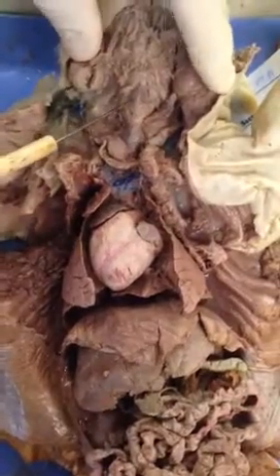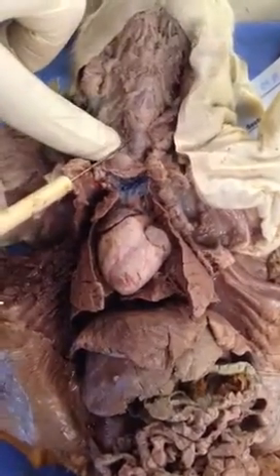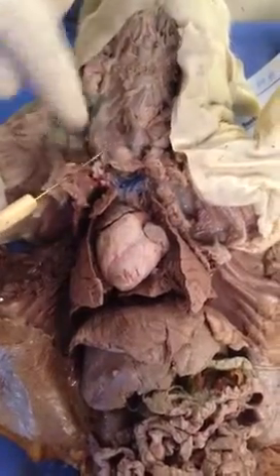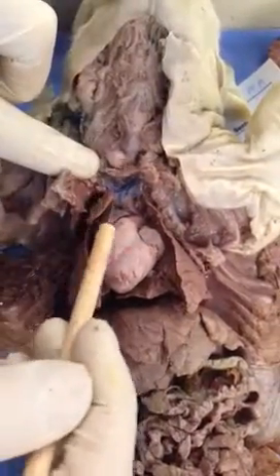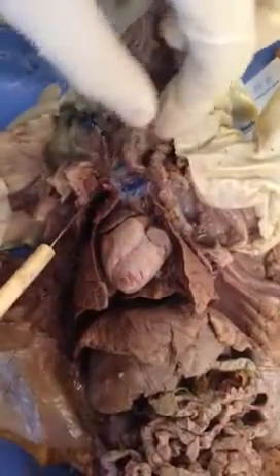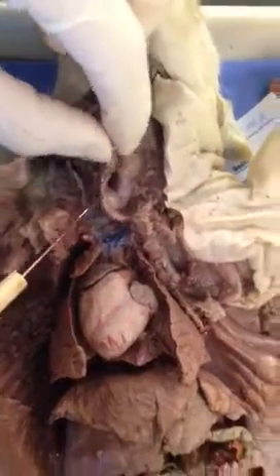So we have the larynx right here, and then it is attached to the trachea, under which is the thyroid gland, this one right here, around which are the thymus glands — this right here, around the thyroid gland. This is the thymus gland.